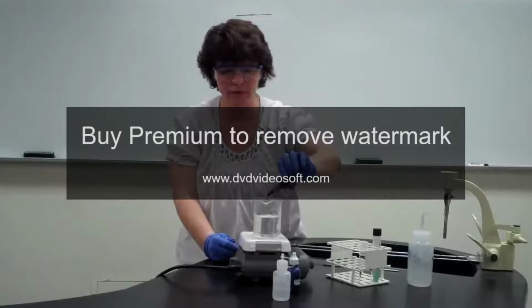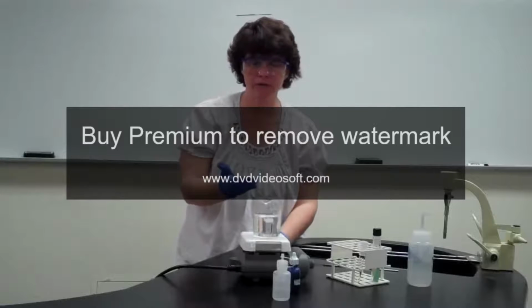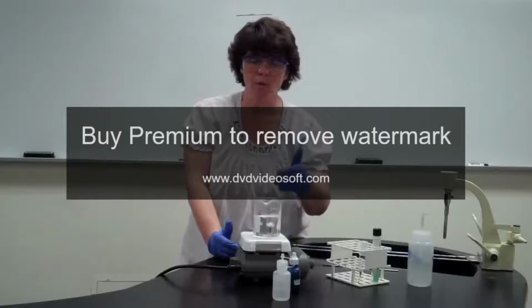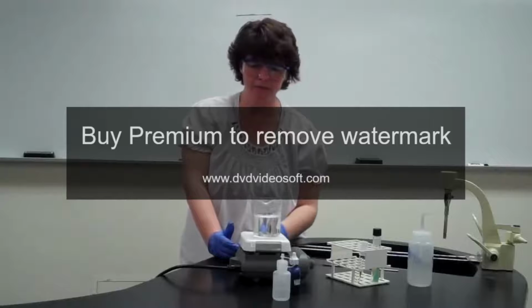So you're just going to put it on there. What you want to make sure doesn't happen is that it dries out. So you're going to put it on there, and it says to let it sit for 5 minutes, and you are going to let it sit for 5 minutes. While this is steaming for 5 minutes, you want to keep an eye on it, because if it dries out, it's not going to stain properly.